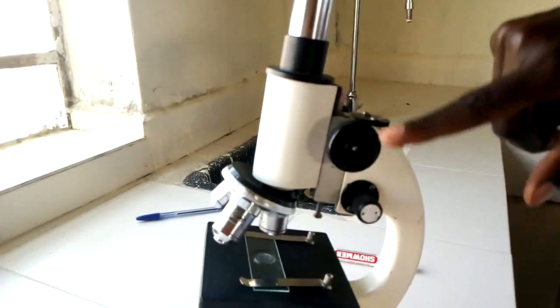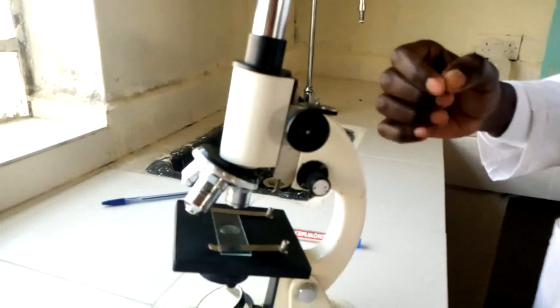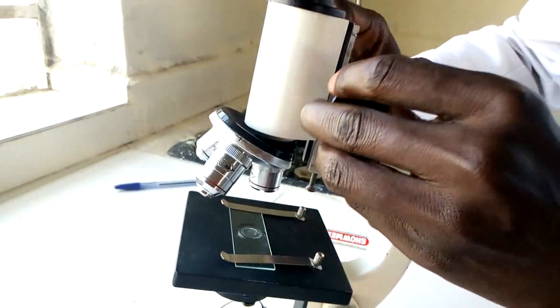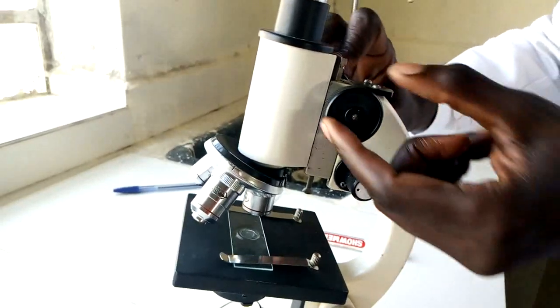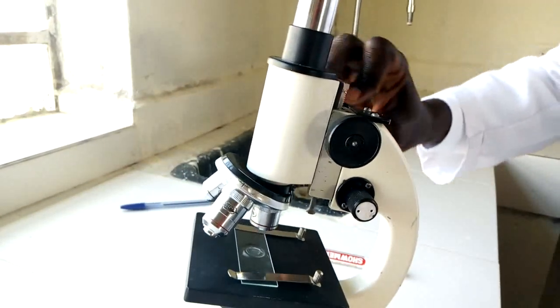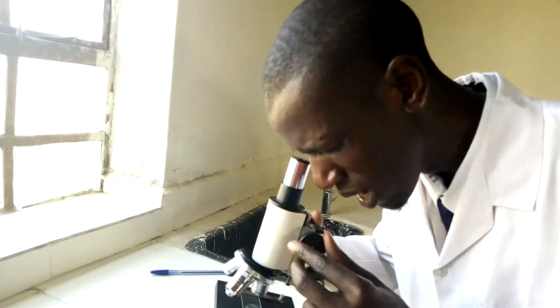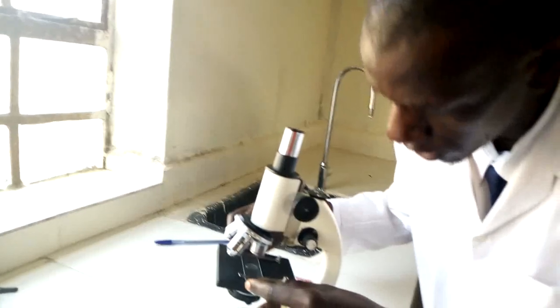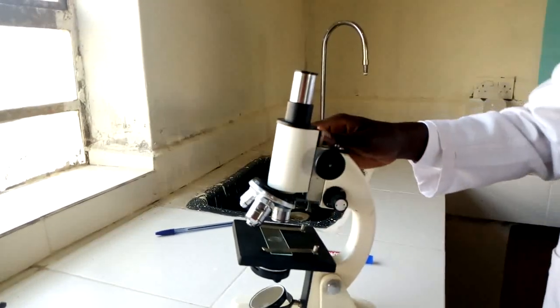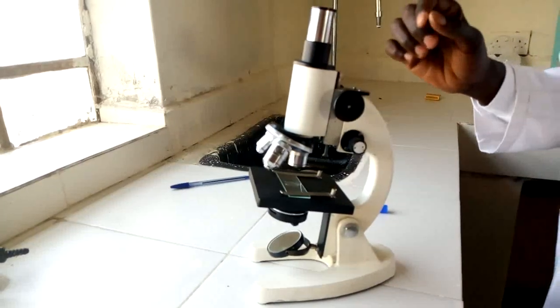We can look at these two knobs. The bigger one found on the upper side is referred to as the coarse adjustment knob. The function of the coarse adjustment knob is to move the body tube into longer distances to bring the image into focus. You use the coarse adjustment knob to move the body tube up and down in longer distances so as to obtain the focus of the specimen.